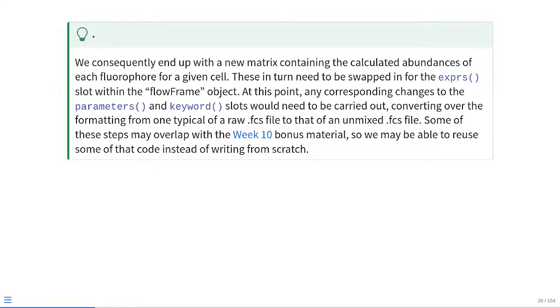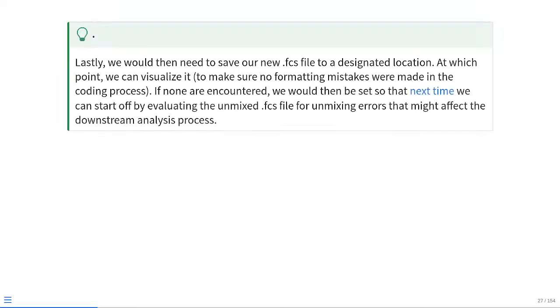Some of these steps may overlap quite extensively with week 10 bonus material, so we may be able to reuse some of that code instead of needing to write it entirely from scratch. And lastly, we would then need to save our new FCS file to a designated location. At that point, we can go ahead and visualize it just to make sure there were no formatting mistakes on our end when we made the coding steps. And then if none are encountered, we would then be set up for next time when we go in and evaluate our unmixed FCS file to see if we can find any unmixing errors that might affect the downstream analysis process.